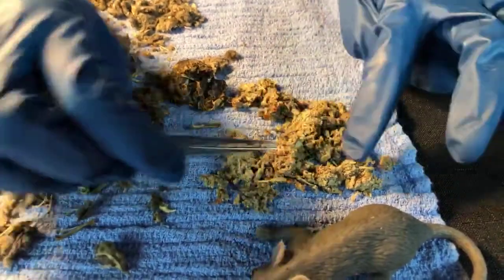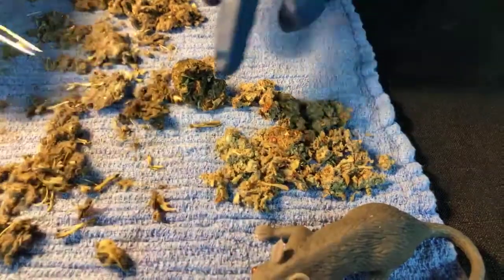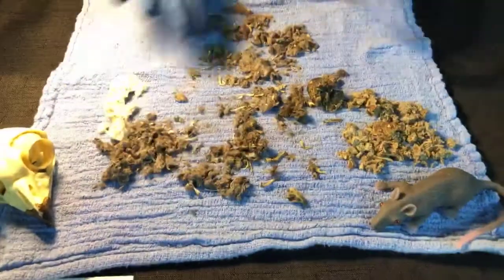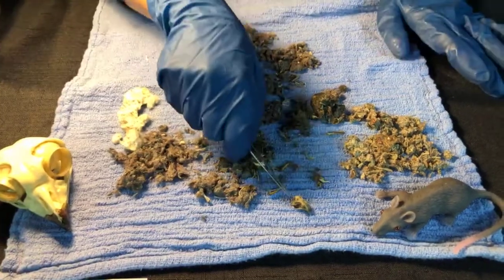And he had a bunch of different stuff. So I just thought that would be neat just to compare that. Obviously not like the hawk. So the hawk we actually have no bones in. Right. Now corvids have a little bit of bones, but of course our owls are the ones that have all the bones in them and the skull, which is really cool.